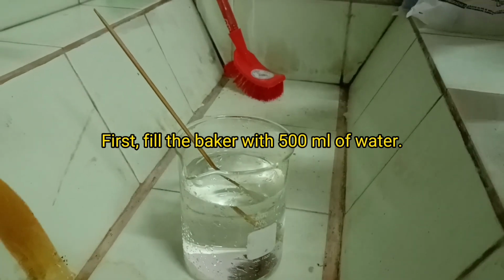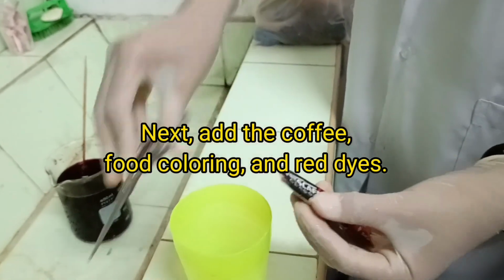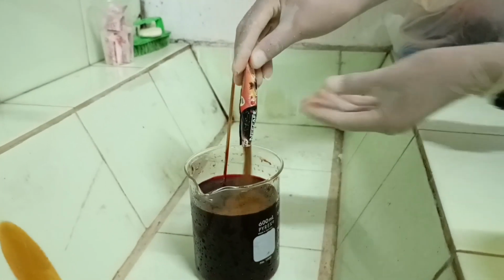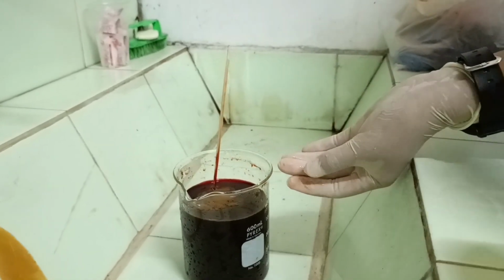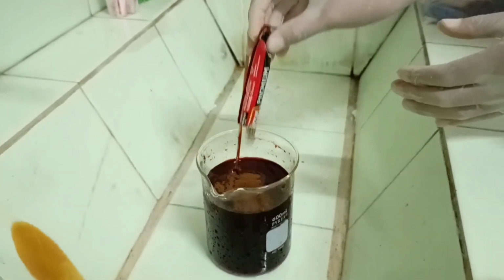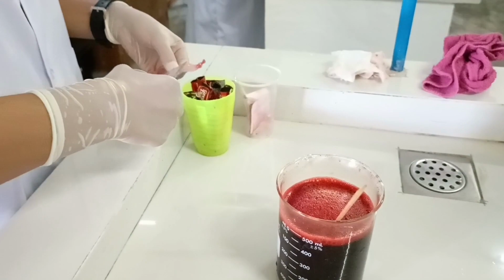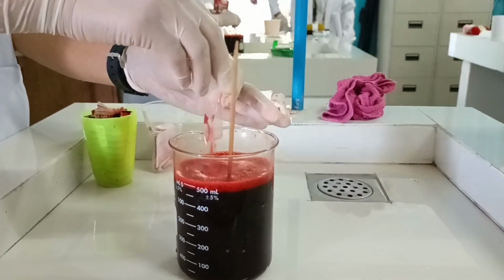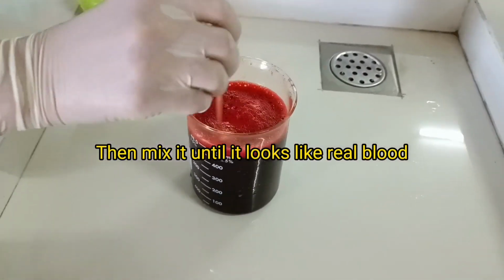Procedures for making fake blood. First, fill the beaker with 500 milliliters of water. Next, add the coffee, food coloring, and red dyes. Then mix it until it looks like real blood.